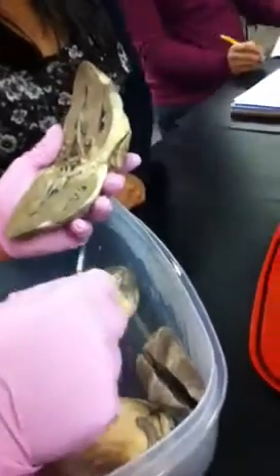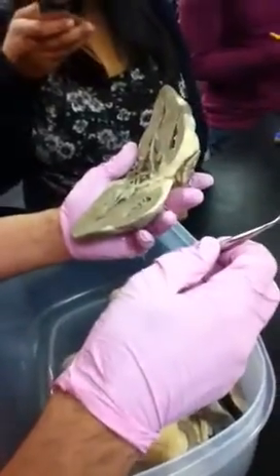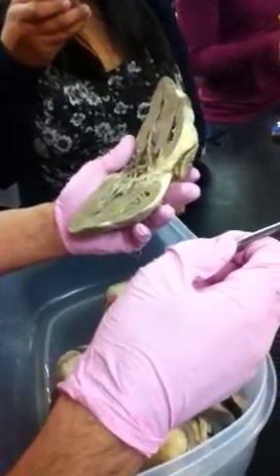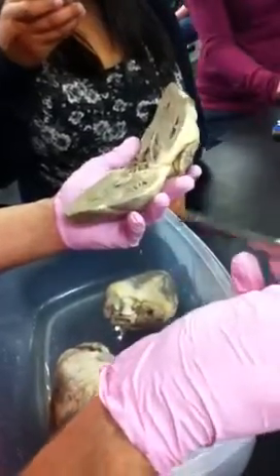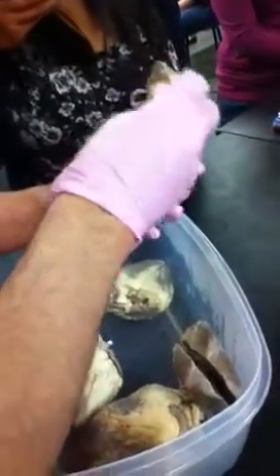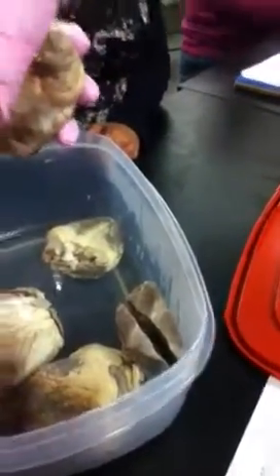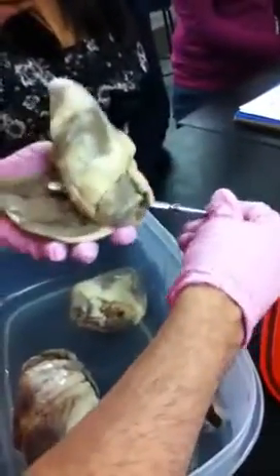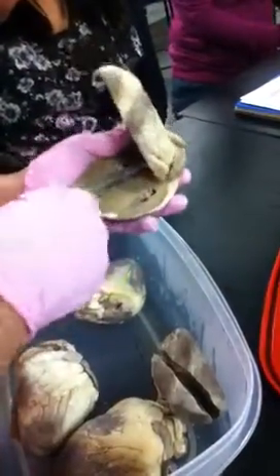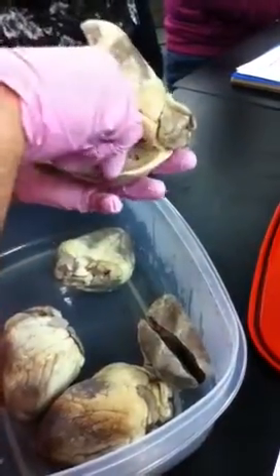AV valve. Right? And remember, aortic and semilunar are going to be in the book. And again, the way that we're going to do the vessels is which hole it's going into. So, if it's going into this hole right here, well, we can find it, right? If the probe is sticking clearly down here, it's the aorta. Right. If it's sticking into the left atrium, what's it going to be?